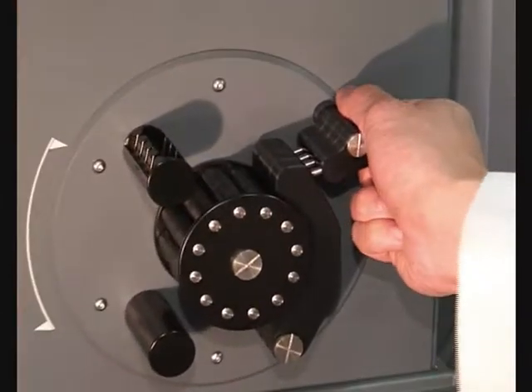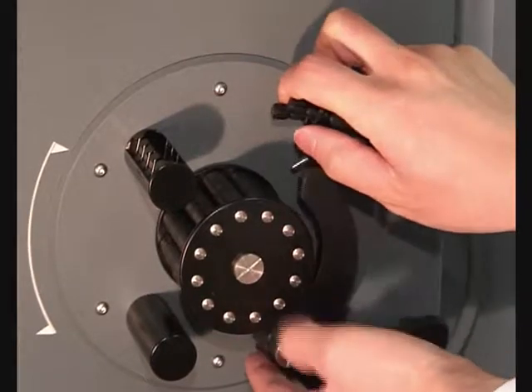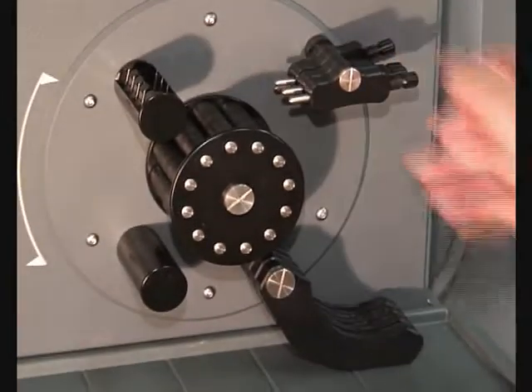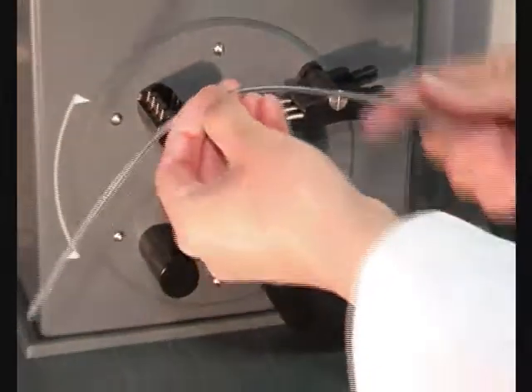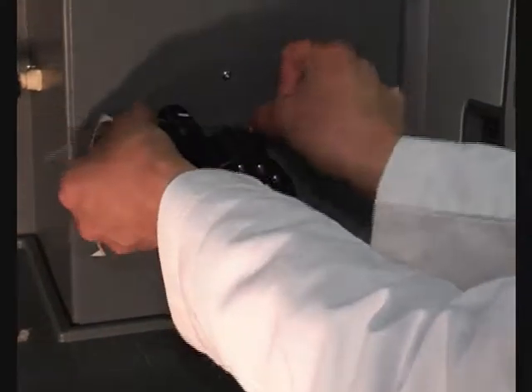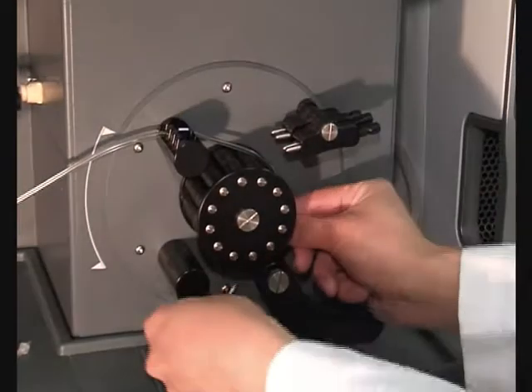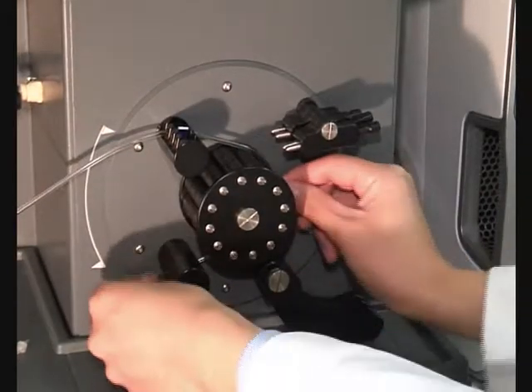Release the pressure bars on the pump rollers. Select the drain pump tubing and place it in the back groove, stretching the tubing clockwise over the pump rollers with the colored tabs securing the tube in the upper and lower tube holders.